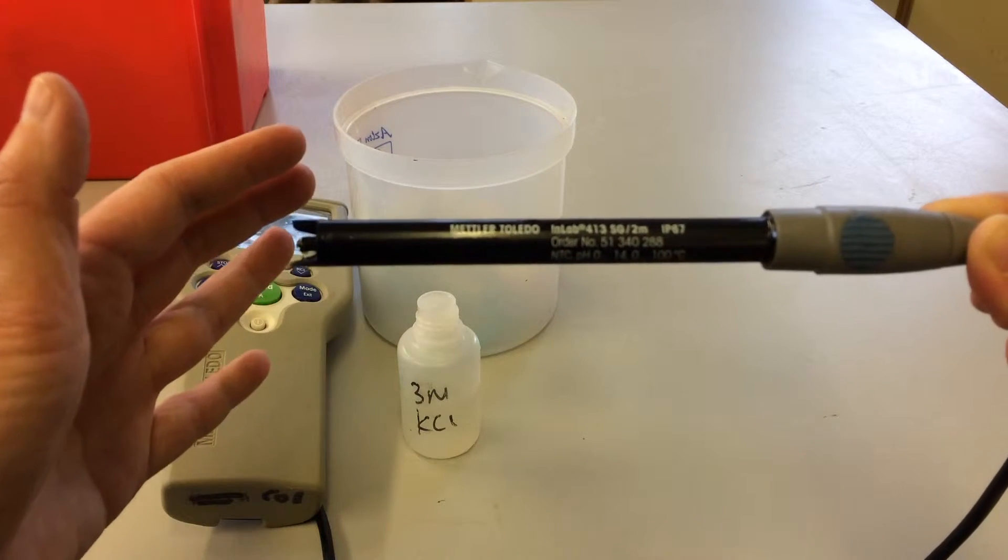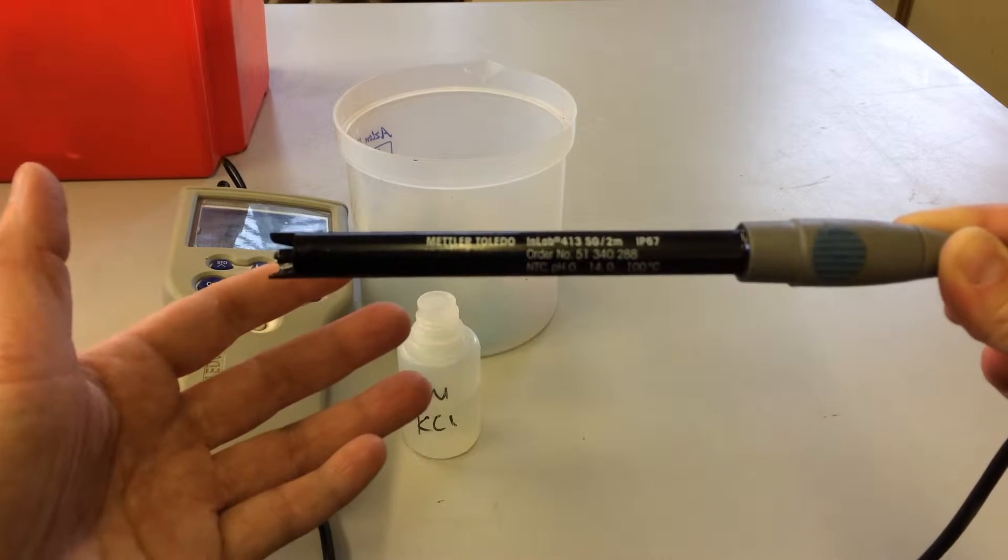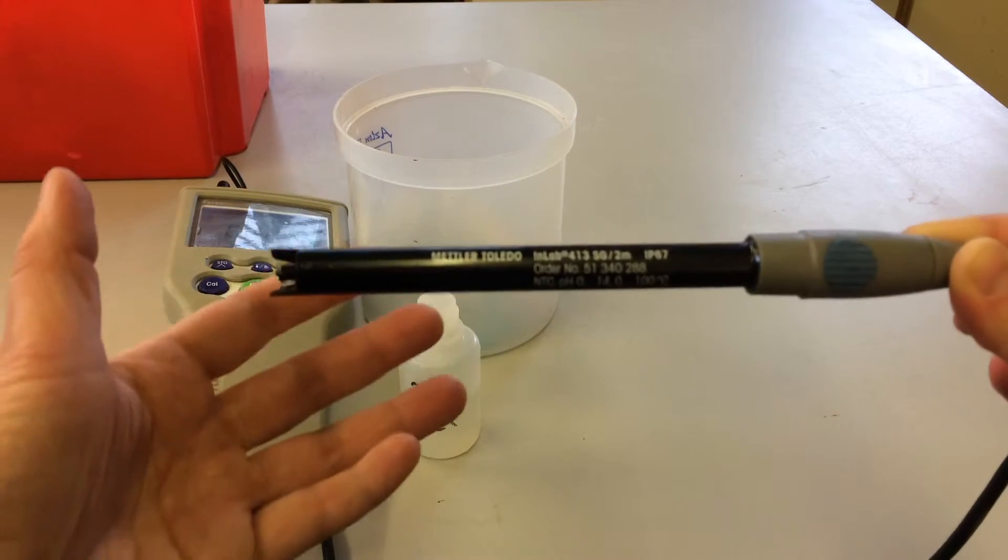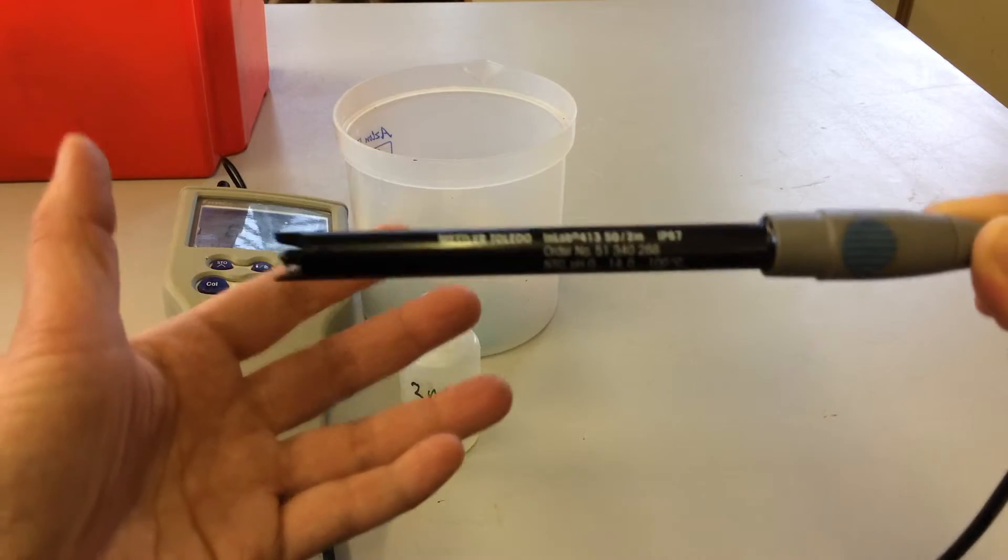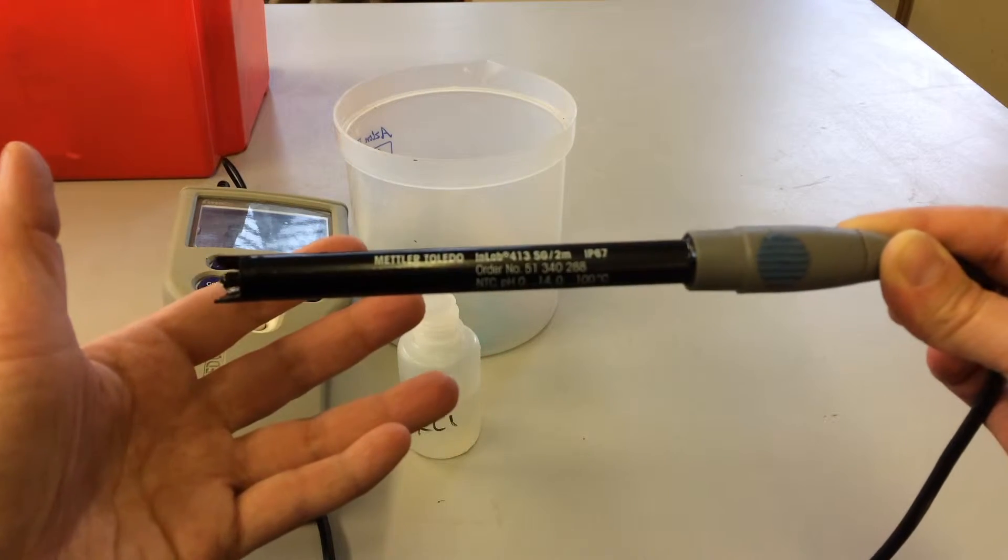Basically, the last thing you want to do is drop this because if you drop it you're likely to break it and we probably won't have the cash to replace it. So just handle this with very great care. Don't be in a rush when you're handling this because that's when mistakes happen. Just take your time.